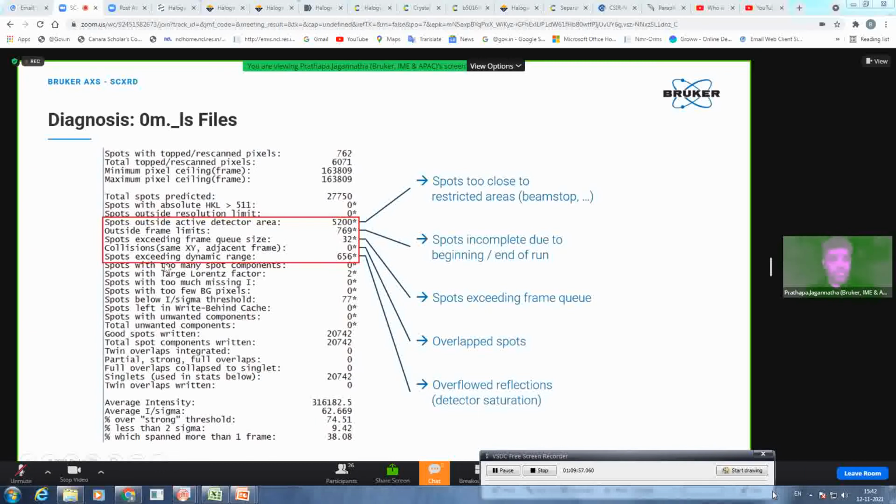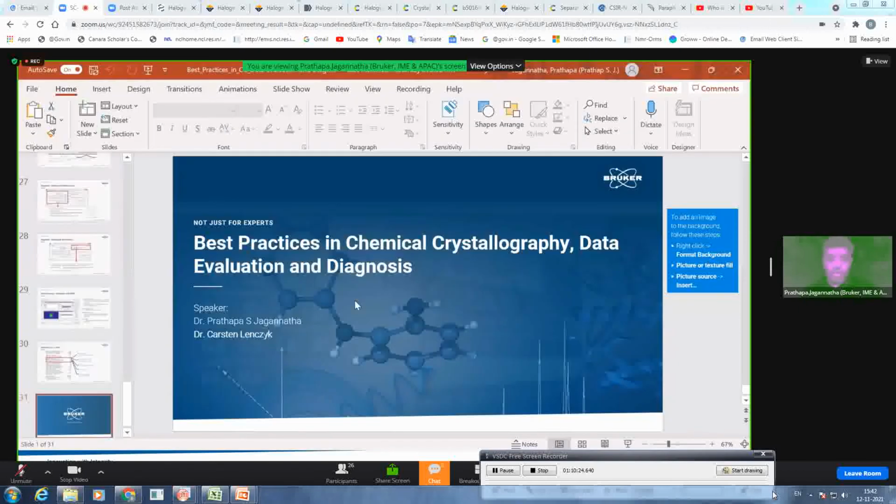And then there are some spots exceeding dynamic range. This is precisely the reason why we use fast scan if it is exceeding the dynamic range. You can get those back using the fast scan, a kind of overflow protection. And if there are spots exceeding frame queue size, you need to change that frame queue from 7 to 10 or 15 or 20 to get those reflections back into play, and then reintegrate as well. Okay, that's all I wanted to show on the slide.